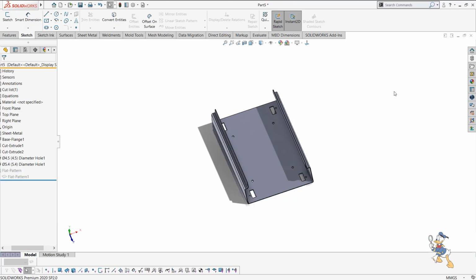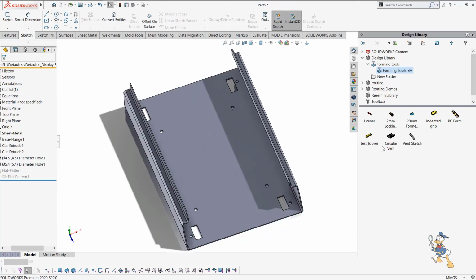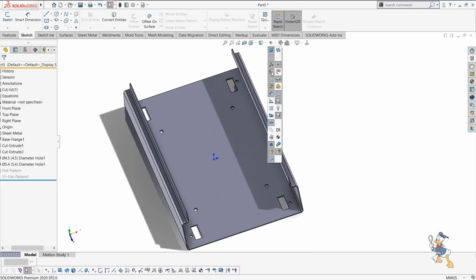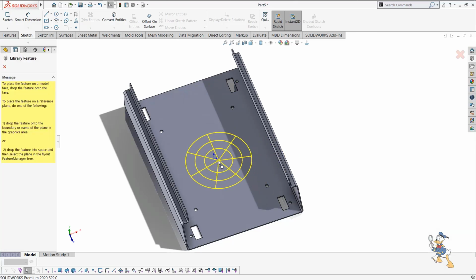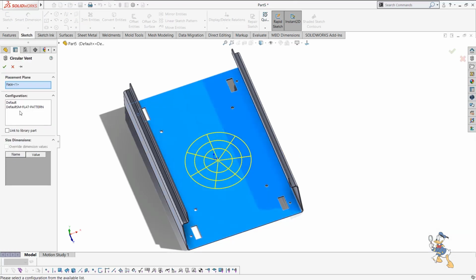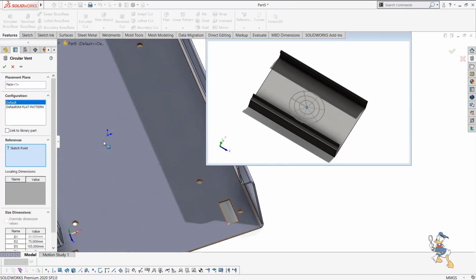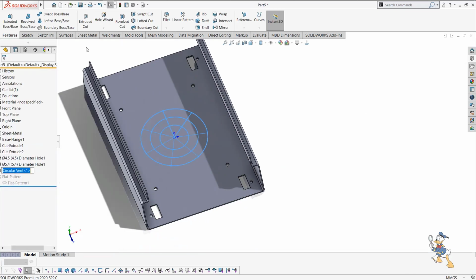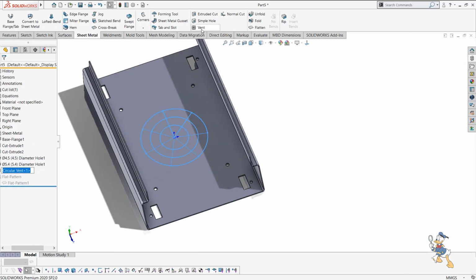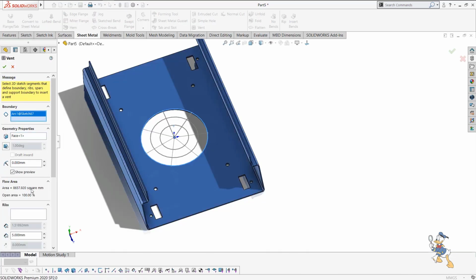Now we just need to use some more tools, like we can design some vent. We just need to design a vent over here, because we know while designing that this component will be heating during operation. So we just need to put our sketch over here. We just need to select the configuration, and then provide a point where we need to put our sketch, and then tick mark. And then in the sheet metal function, we just need to click on the vent feature. We need to provide the boundary of this.